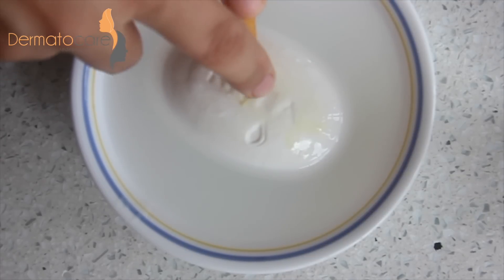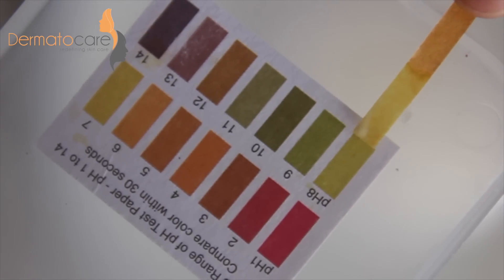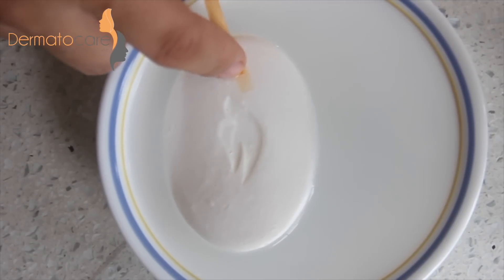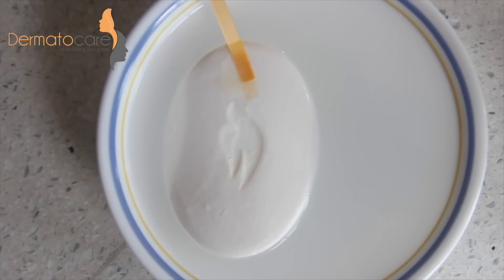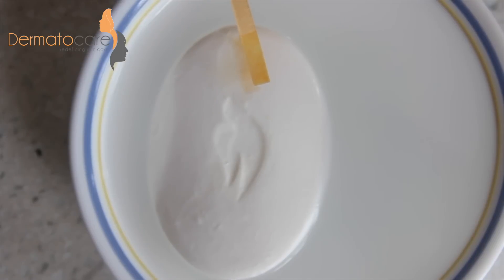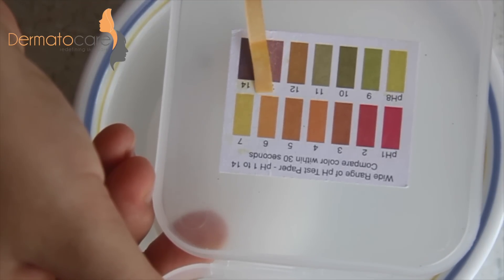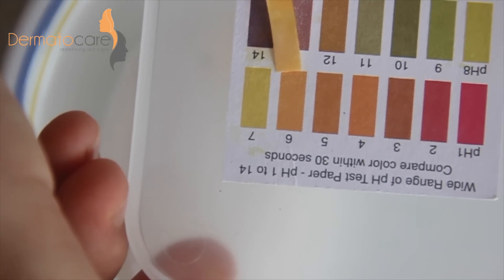Next, I am testing the pH of another trusted brand. It also has slightly alkaline pH somewhere between 7 and 8. Finally, I am testing the pH of this high-end beauty bar. Unlike all other soaps, the pH paper is showing a slightly orange tinge and thus it has acidic pH. Here you can see that the pH is around 6.